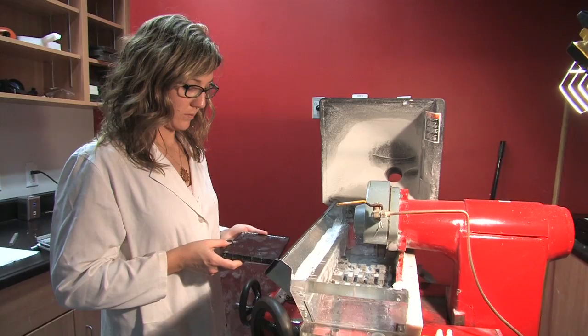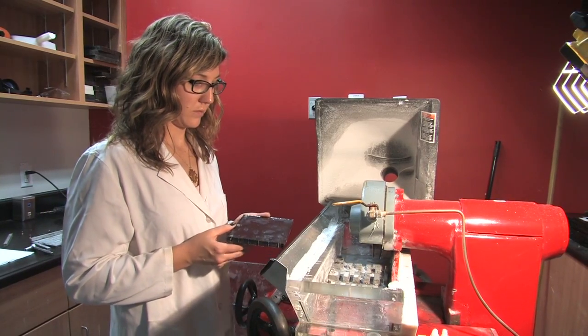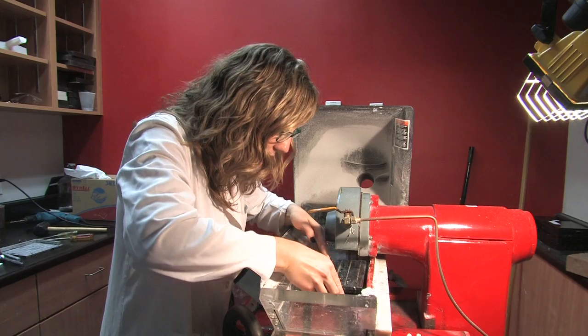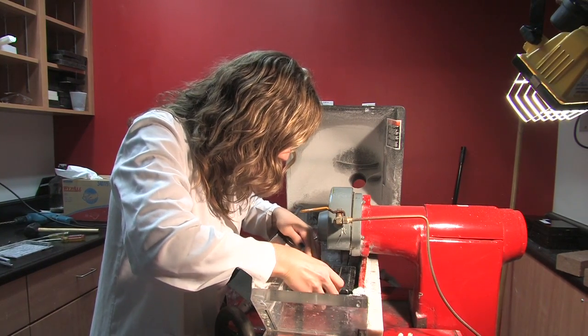To actually cut your plate, set the plate on the pegs of the saw using a ratchet to tighten the screws until the plate is secure. You'll want to put the plate in upside down to what you poured it in the tray.